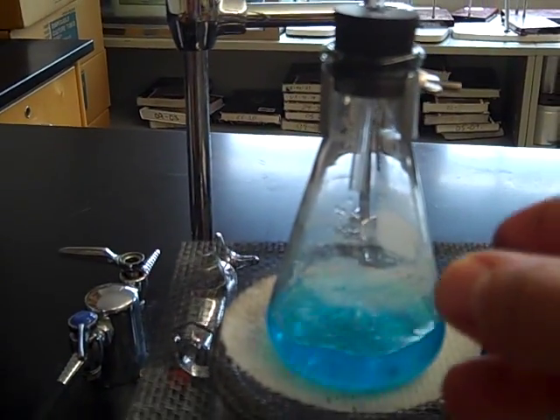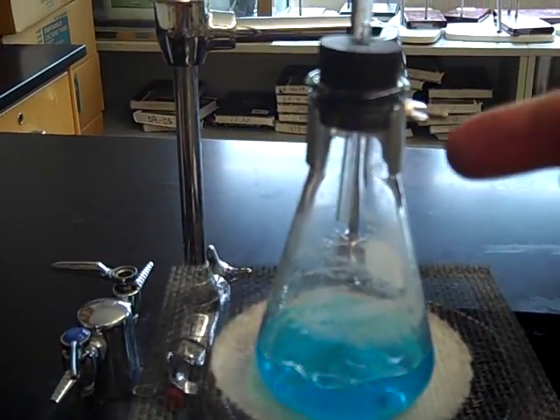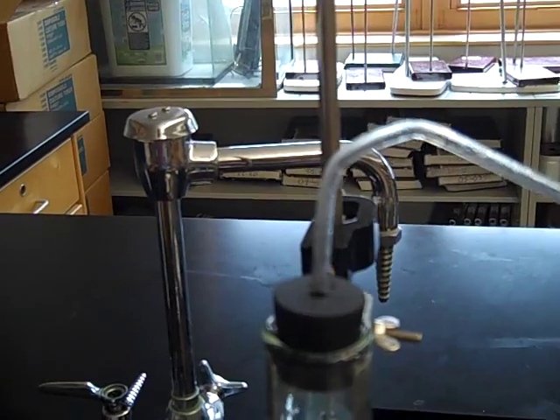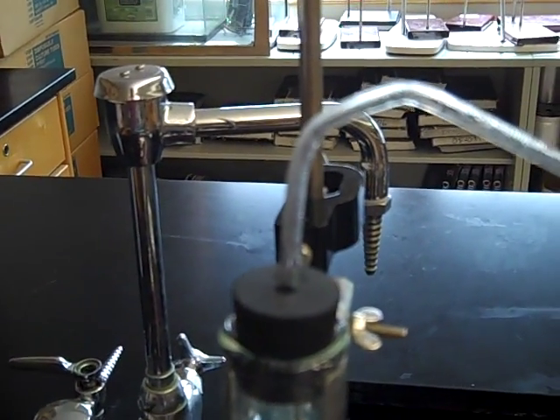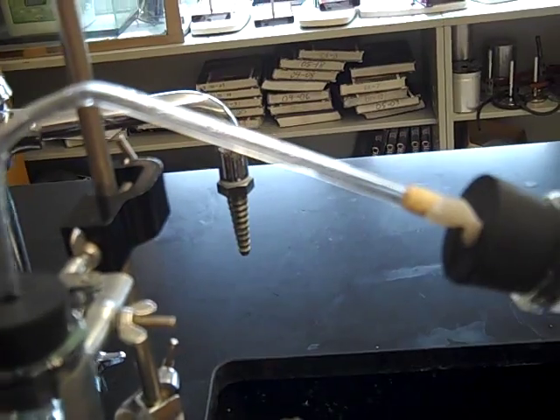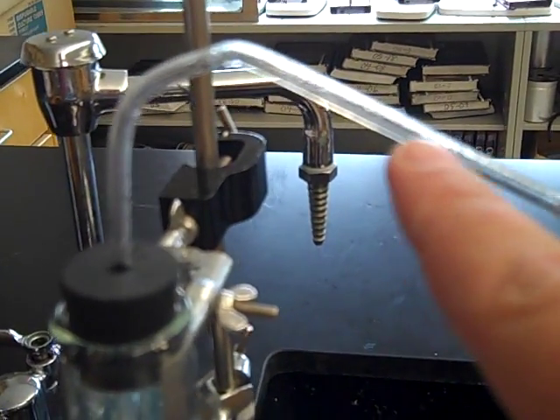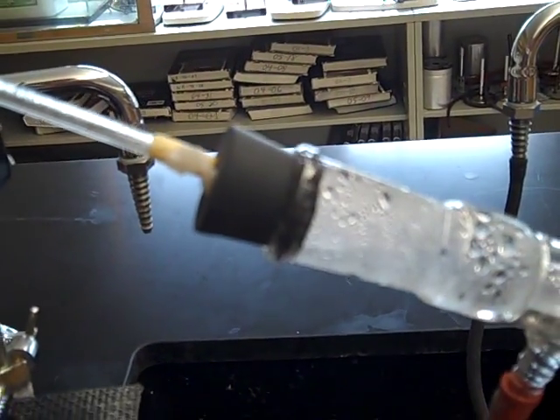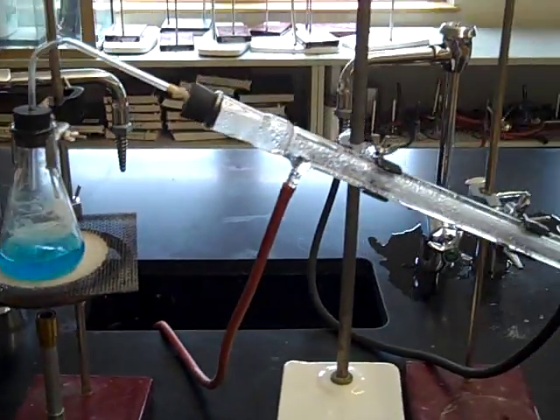The water is vaporizing, it's coming up this column, going up this tube here, that's a different type of tube, not the one you're used to online. And the water vaporizes because it has a lower boiling point than our copper sulfate.